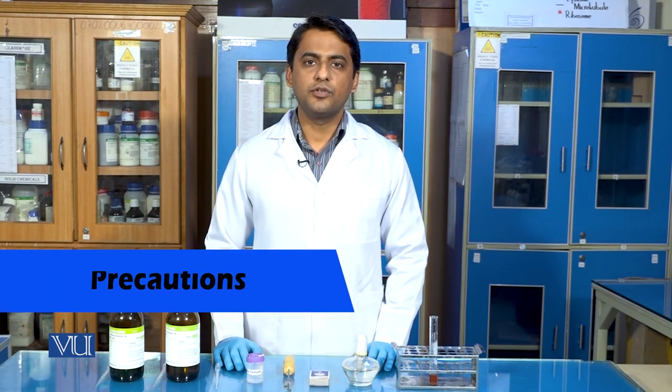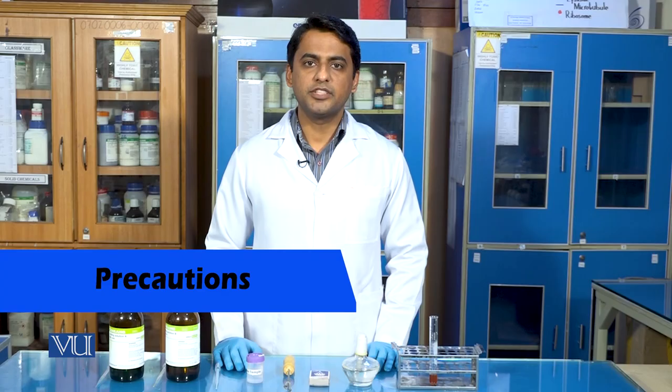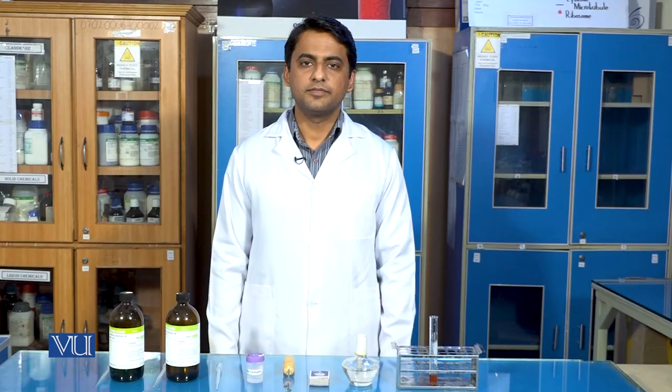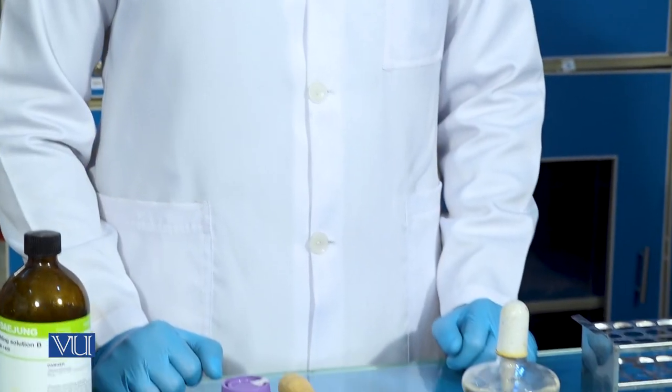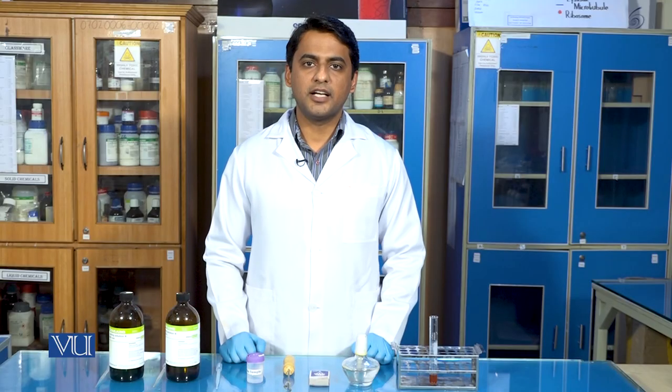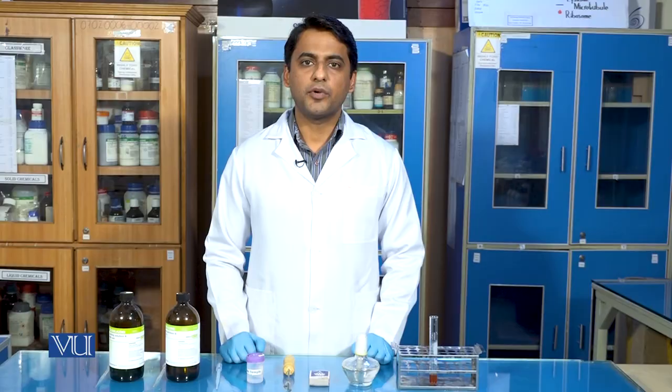Do not forget to take few precautions, among which always wear hand gloves, wear lab coat, do not touch any reagent bare handedly, and in the end always discard every consumed material in a proper manner.